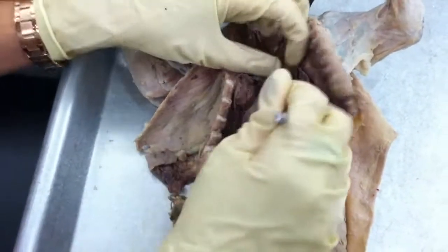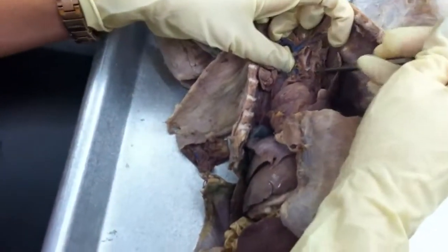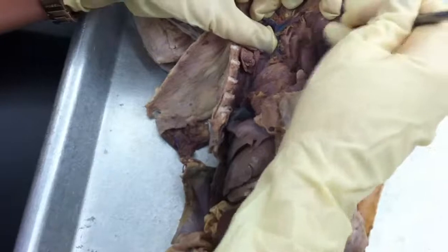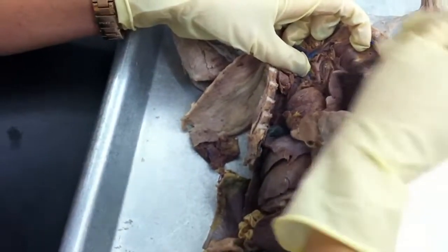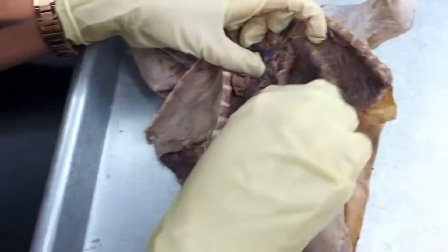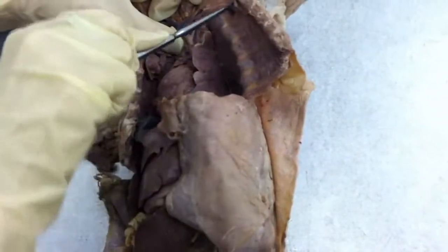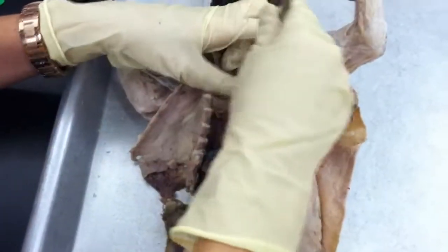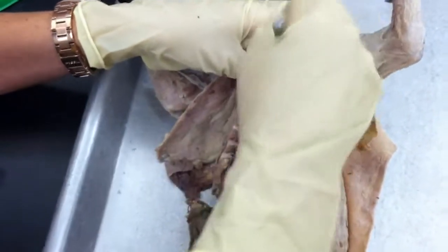And also coming off of your left subclavian, sometimes they're hard to find, but you'll have the first branch that you get to, kind of really hard. That's just fat. But one of them runs over into here. That's your internal mammary. And then the second branch coming off goes deep into your vertebrae, and that's your vertebral artery.